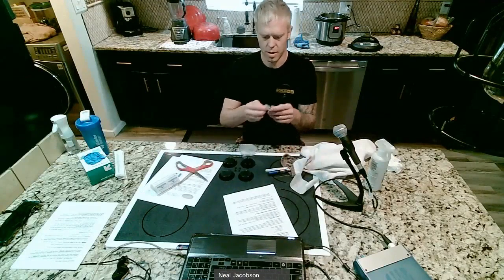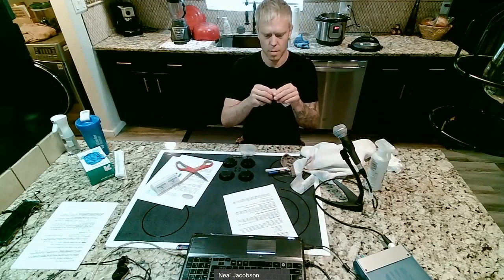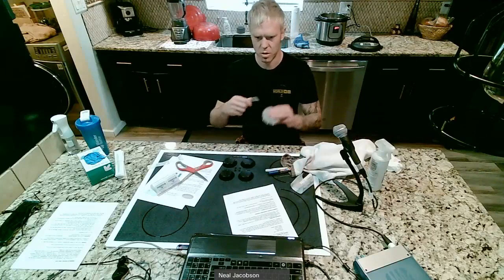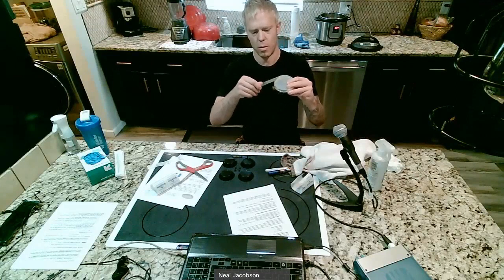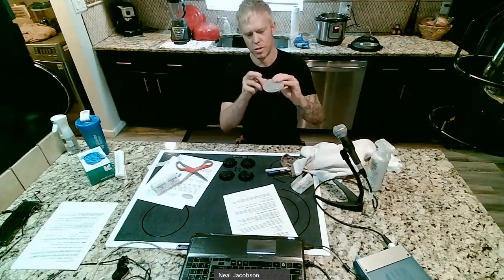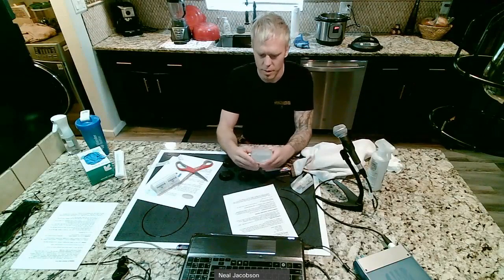And then we'll take that parafilm and peel it away from the backing. What this is going to do is seal the edges around your petri dish. So with the thumb, you're just going to hold it in place and then pull it tight as you wrap it around the outside of your petri dish, forming a seal around it. So you seal up the whole petri dish.